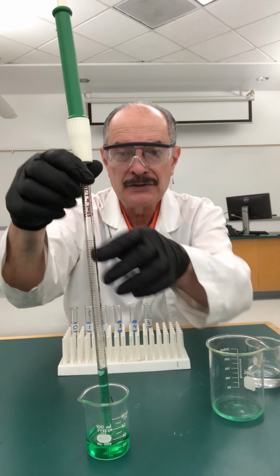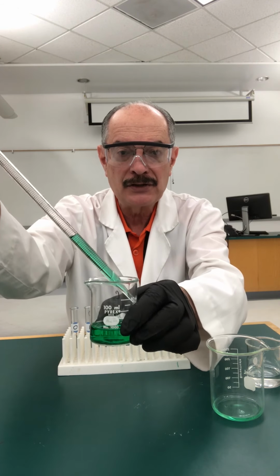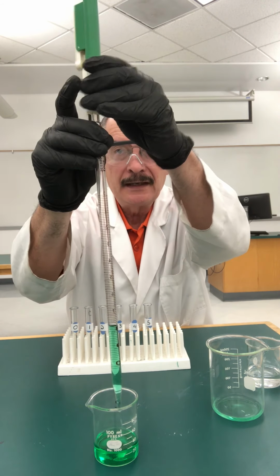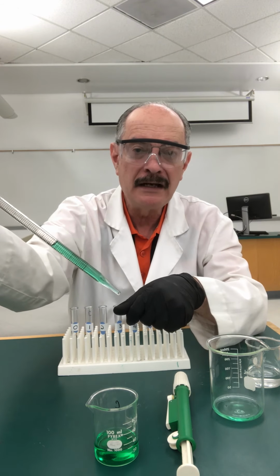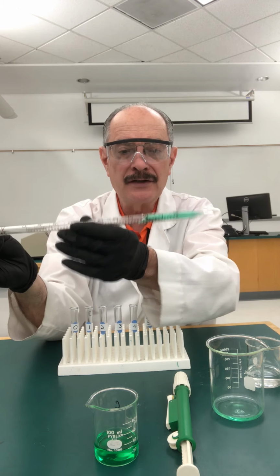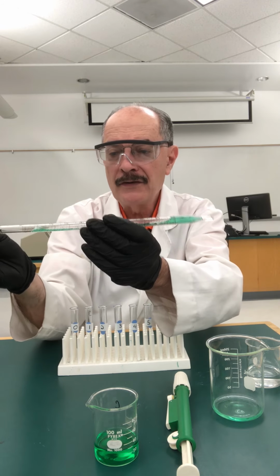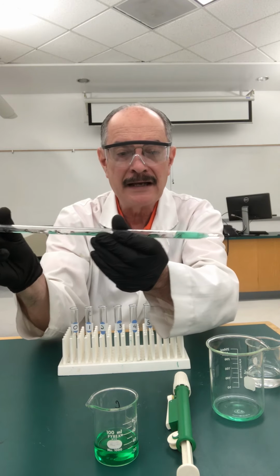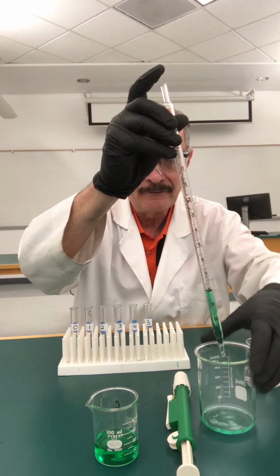And now what I'm going to do, very carefully and very rapidly, is keep the tip of the pipette touching the glass. And then very quickly, I'm going to remove this and hold it with my finger, so that I have a few milliliters of liquid in there. And then like I did with the burette, I'm going to turn it on its side and roll it around, so that I can get all of the interior of the pipette coated essentially with my solution. And then I'm going to drop it into a waste container.